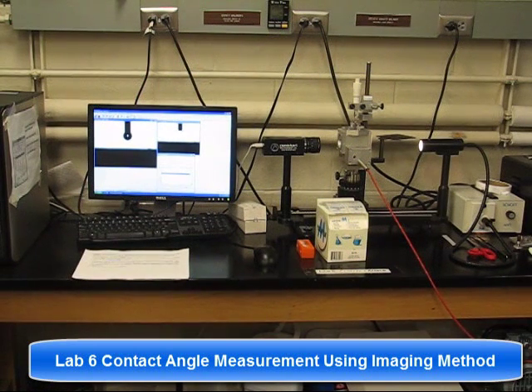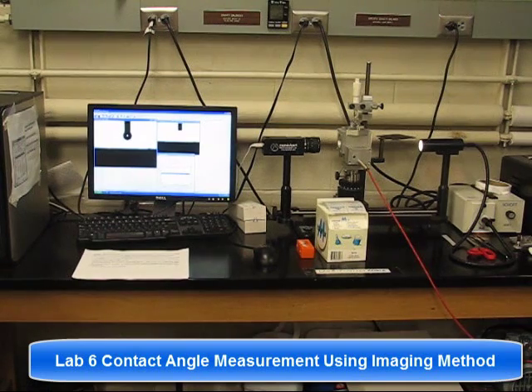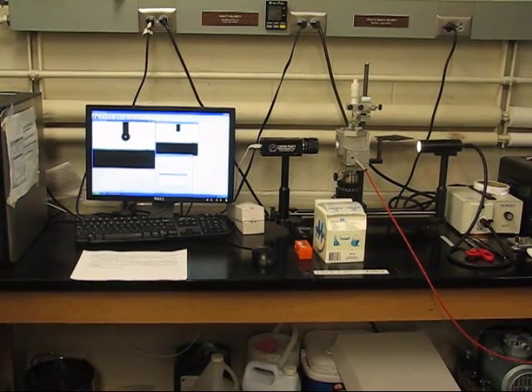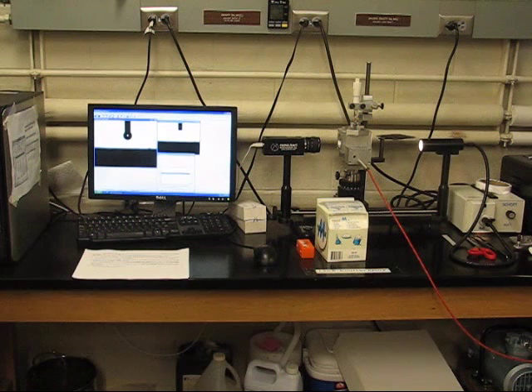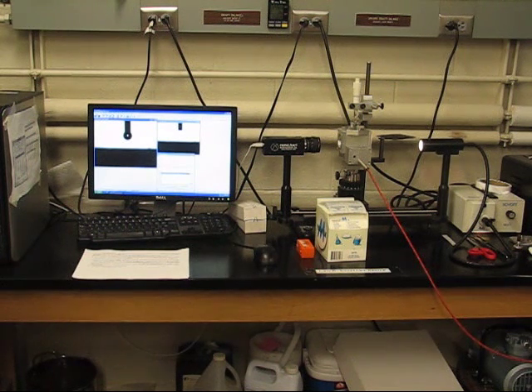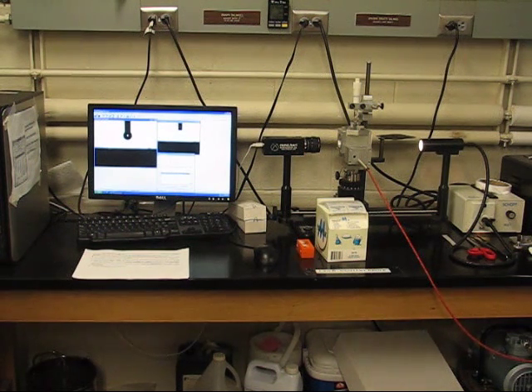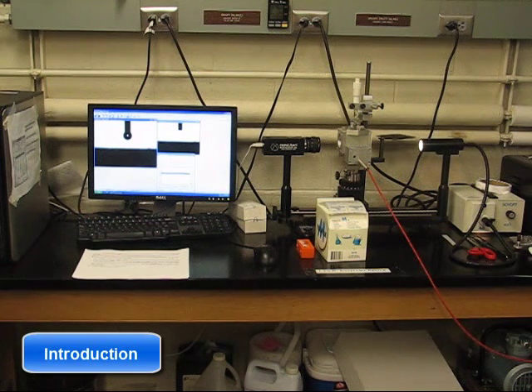Welcome to Lab 6: Contact Angle Measurement using the Imaging Method. When a liquid is brought into contact with a solid surface, the liquid will either expand over the whole surface or form small drops on the surface.